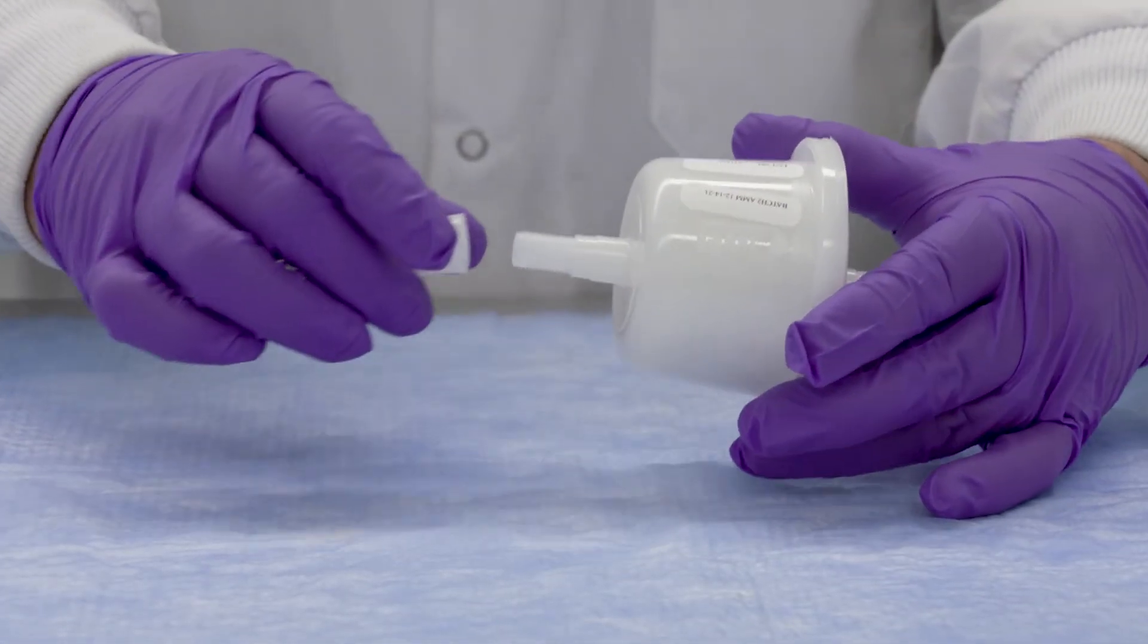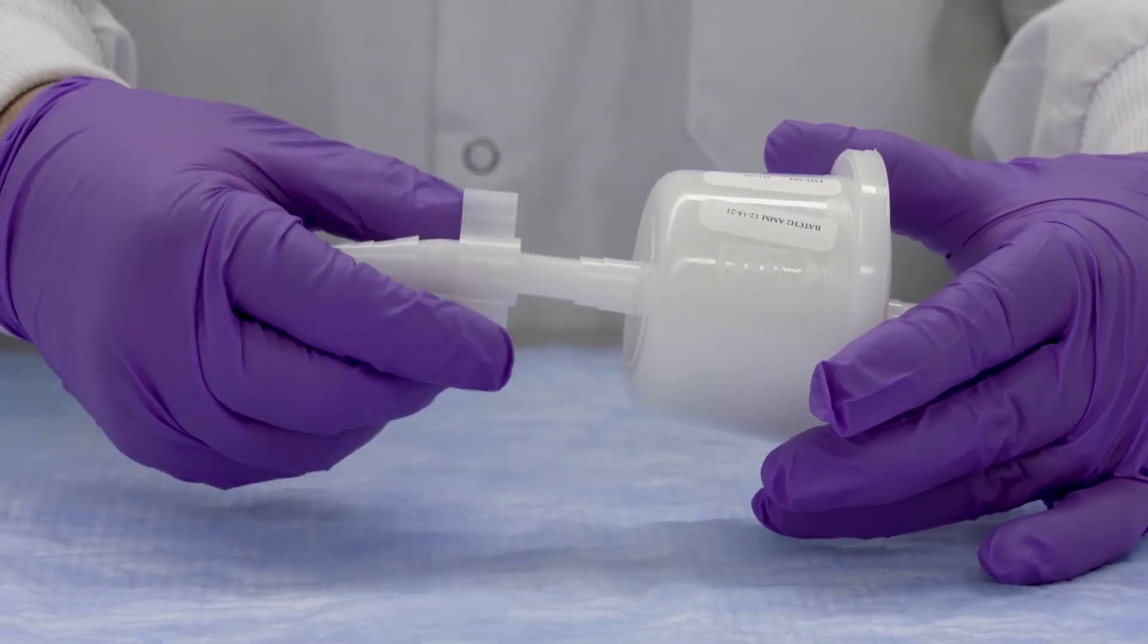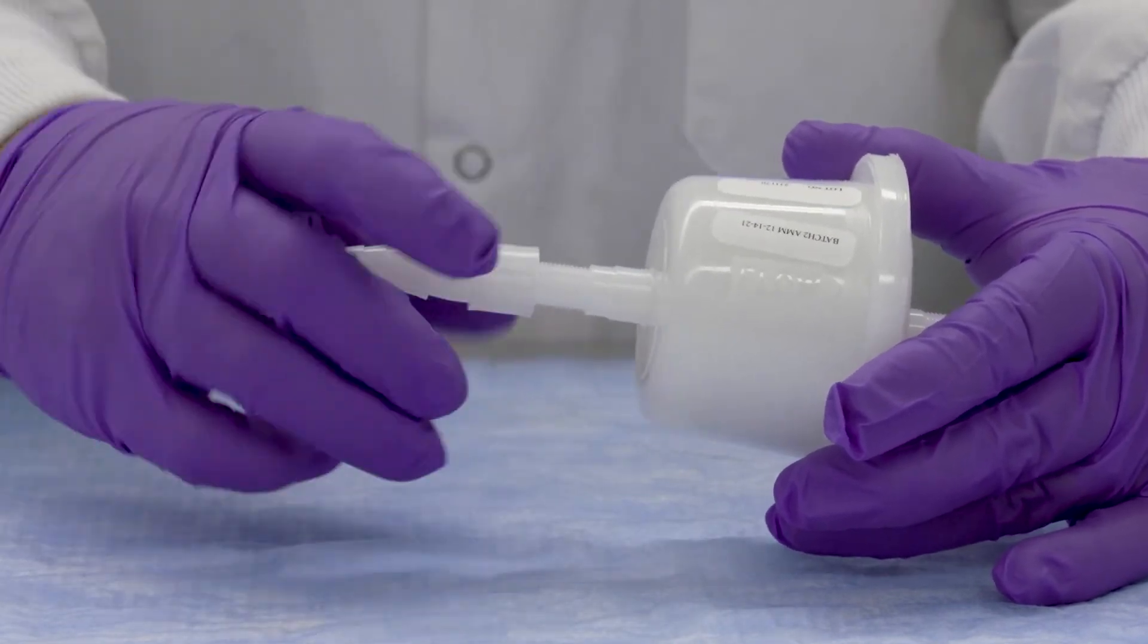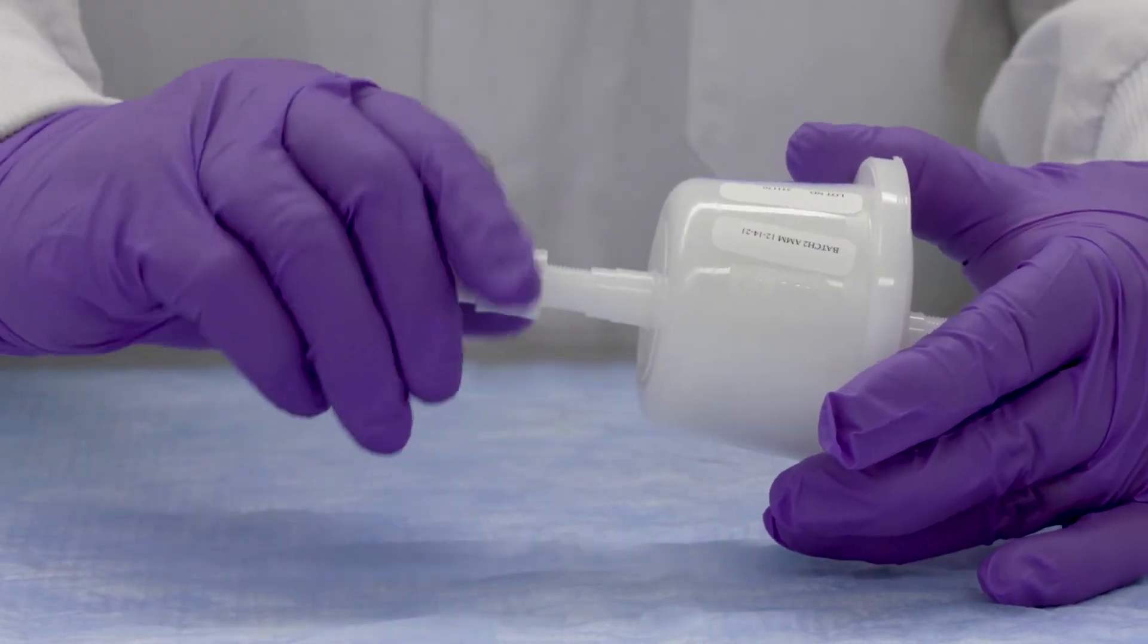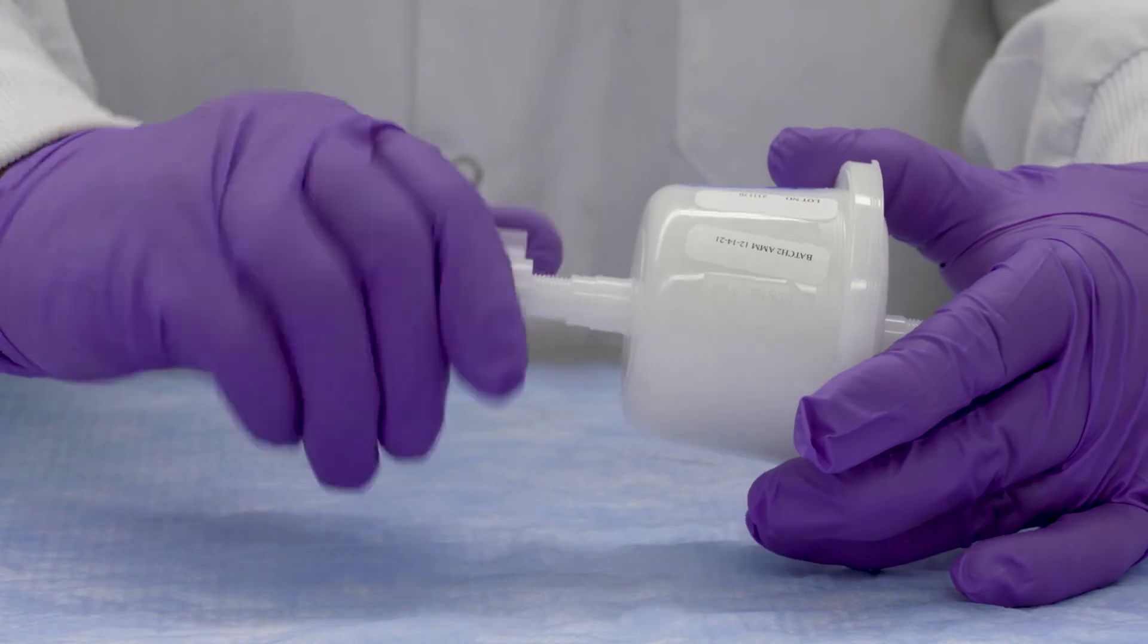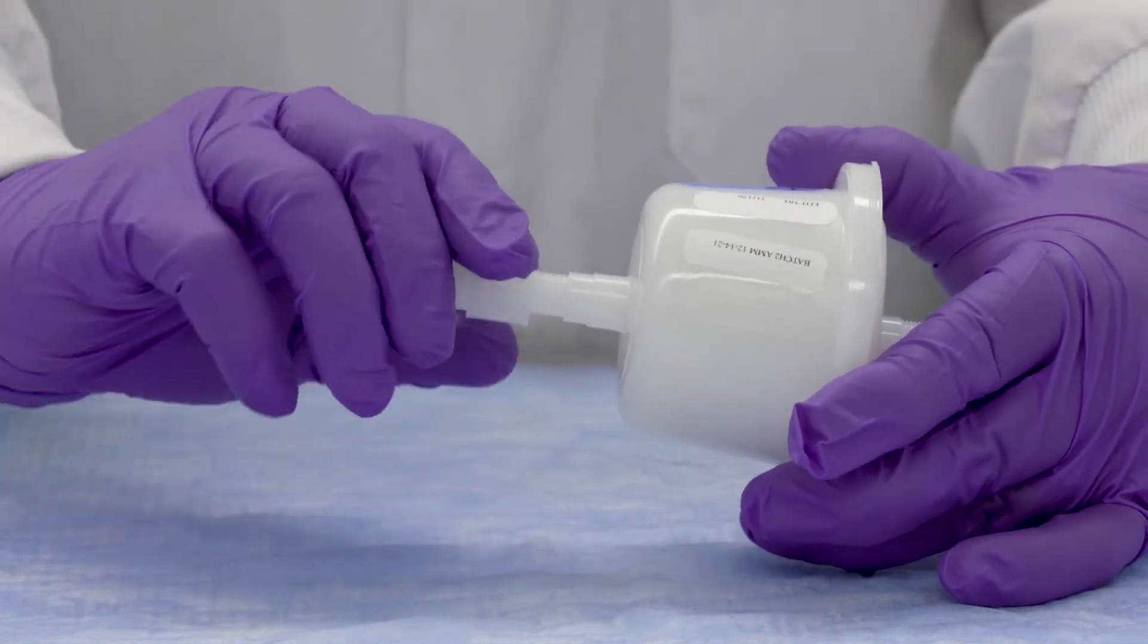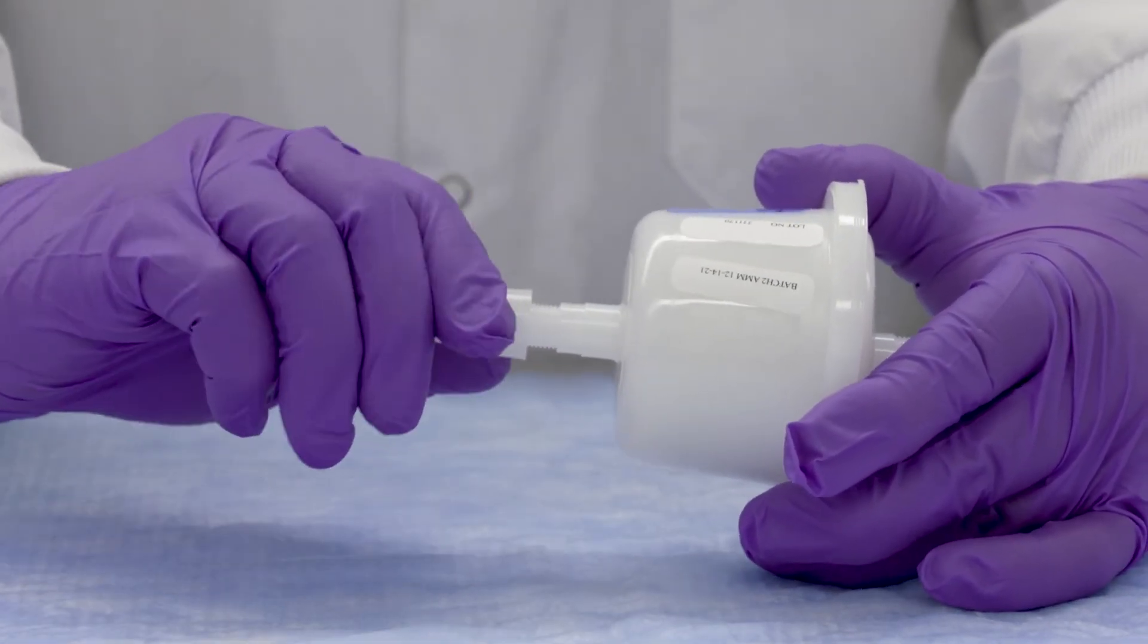Attach a 1/8 inch male national pipe taper or NPT external threaded connections or stepped hose connector adapter to the sampling capsule inlet. A hose adapter could also be used for flow outlet connection.